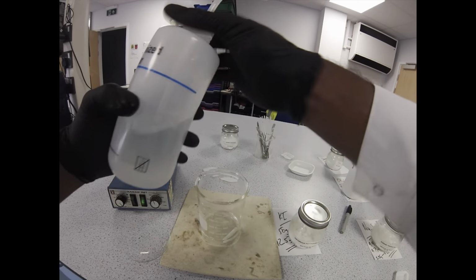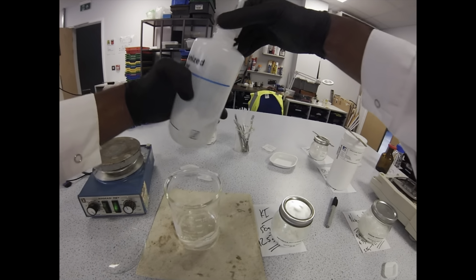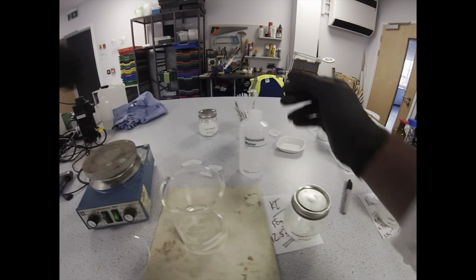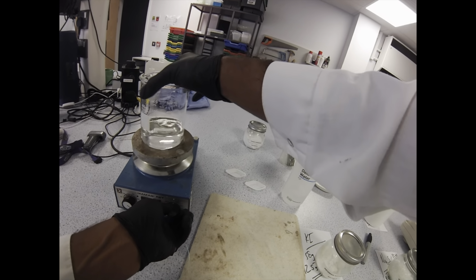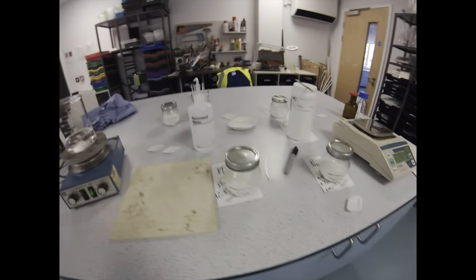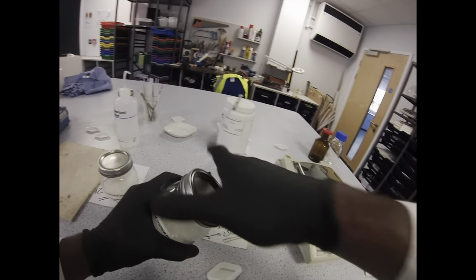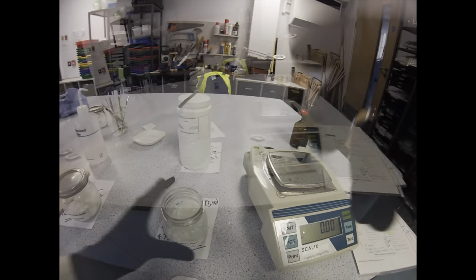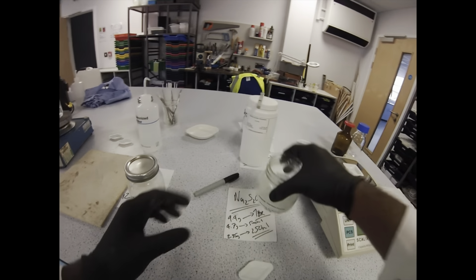There's a really nice tweak on this reaction in A-level chemistry where students adjust the amount of potassium iodide in the solution to change the timing. So many other topics this could be used for. Very, very versatile. Intro to chemical reactions as well. I really like, if I have some solution left over, I'll use this one. So yeah, there are lots of pros for using this one in your lessons, but all in all, it's the absolute wow factor of that colour change.